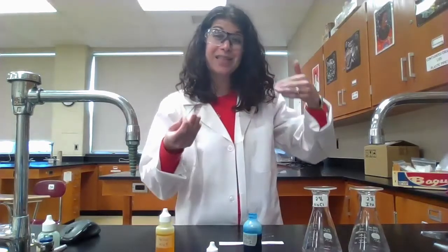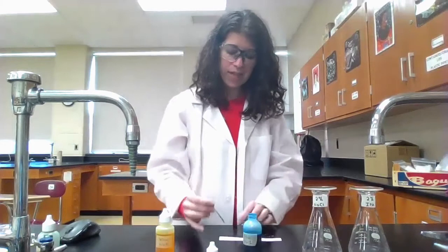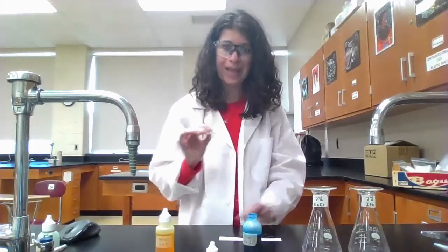We really want everything tight, so we want the small spot, not the large one. But we also need the dye to be concentrated enough that I can still see it as it moves up the page. That's why the procedure says to spot quickly, let it dry, then spot again multiple times — so the dot doesn't get bigger, but becomes more concentrated.